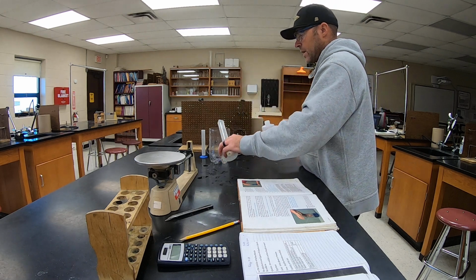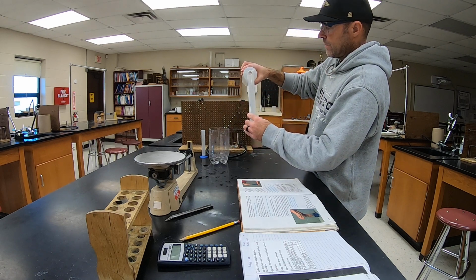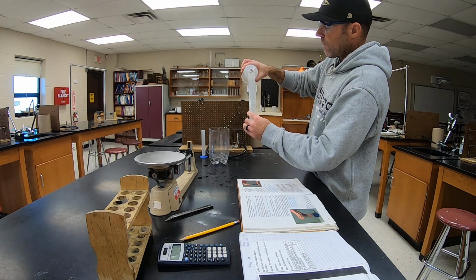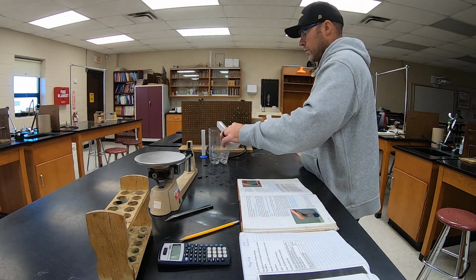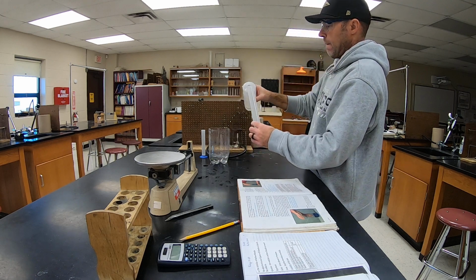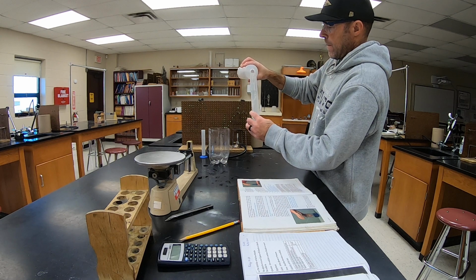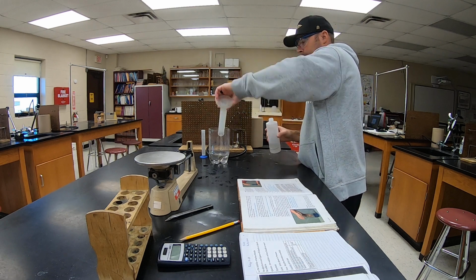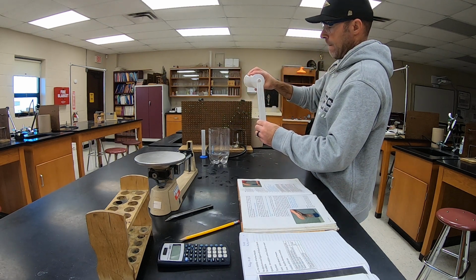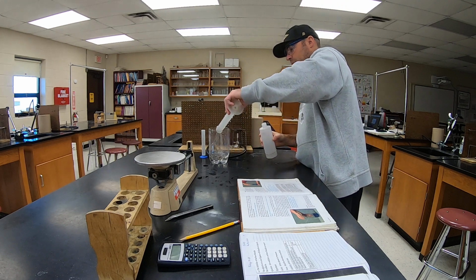So there's 100, and I'm going to keep it in here just in case I make a mistake. So 100, 200, 300, 400.